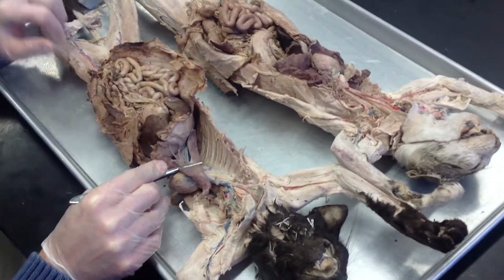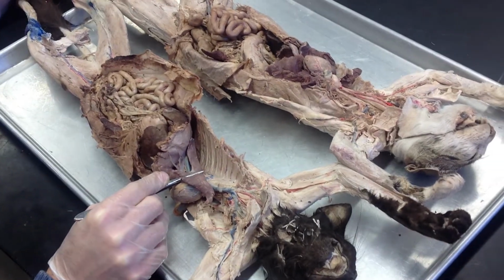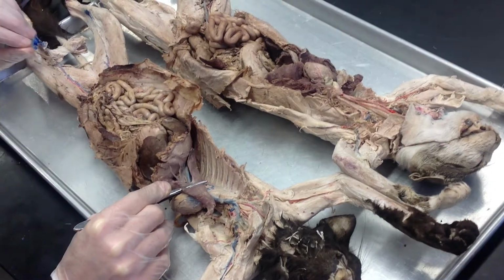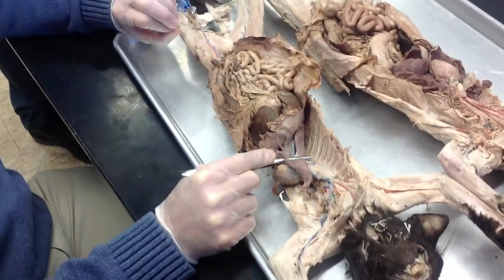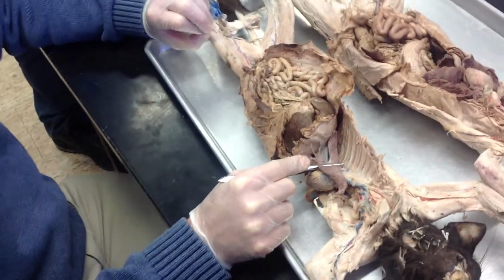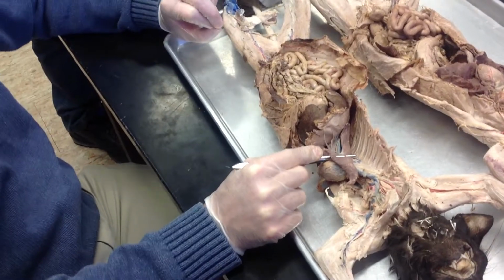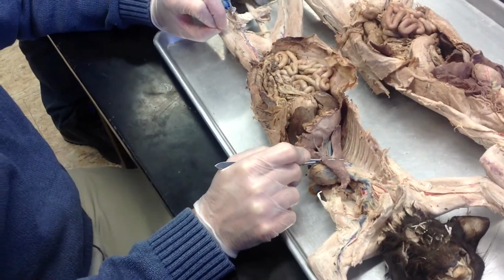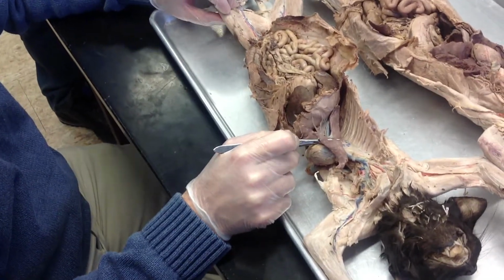A lot of people would think the inferior vena cava. That would be a very good guess. You being advanced students, you know that guess is wrong, so that's why you didn't say that. The inferior vena cava would be a good guess, but it's wrong. You actually have to rip the liver apart to see the inferior vena cava. This one is on your list. I love this vein, but I don't know why it's on your list, but it is.